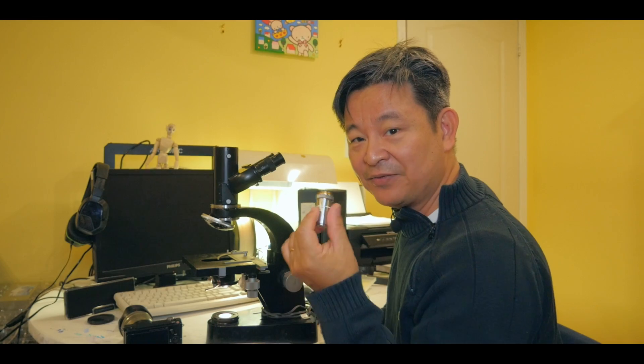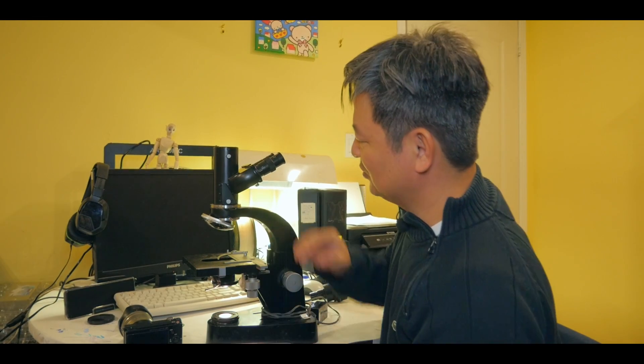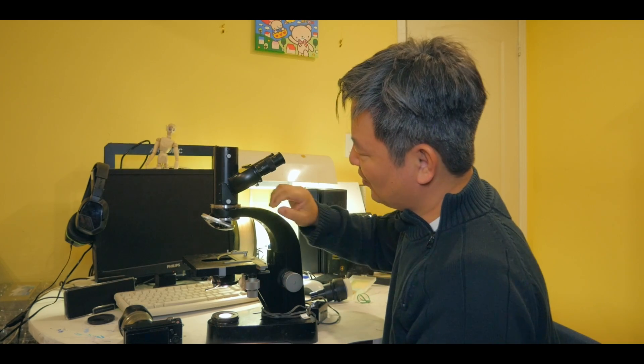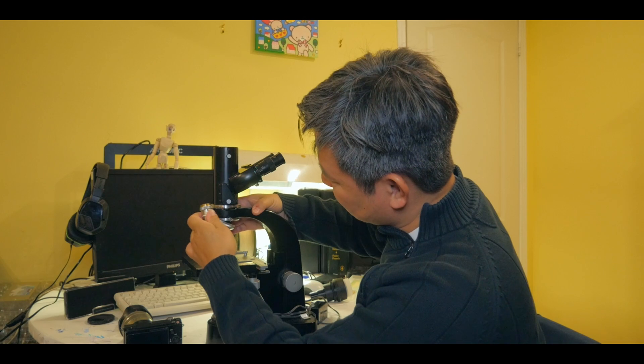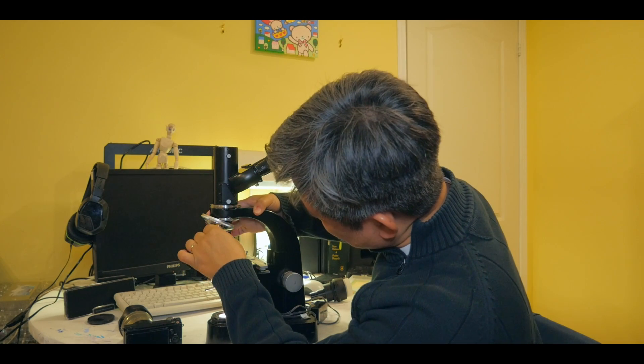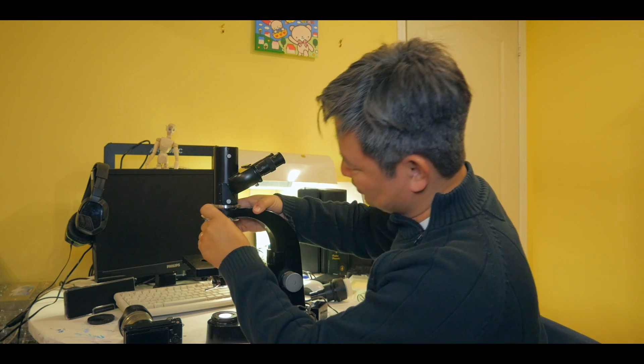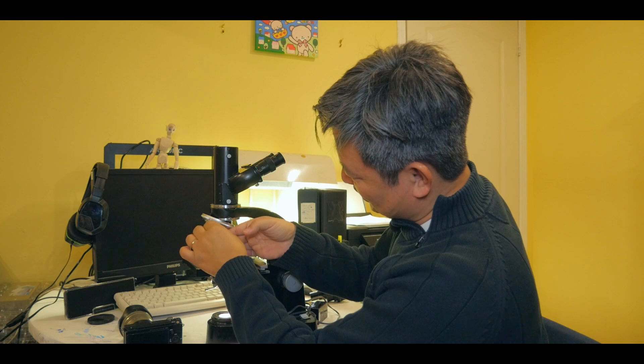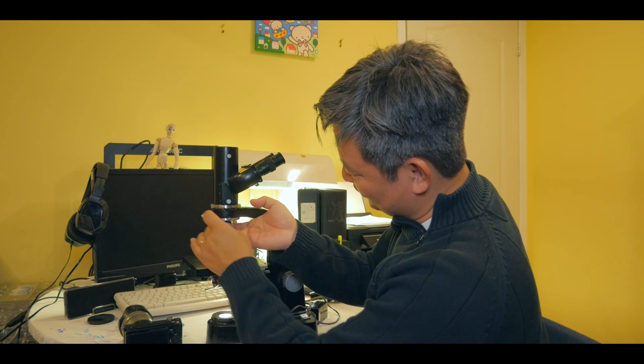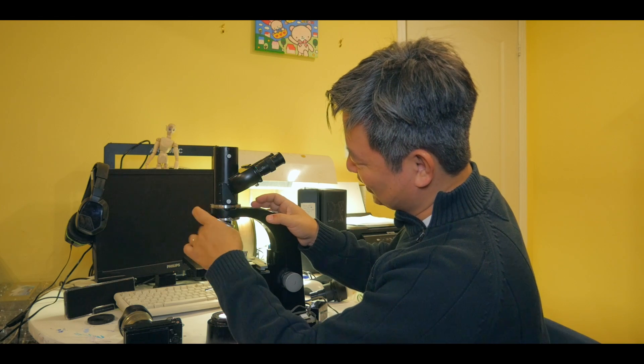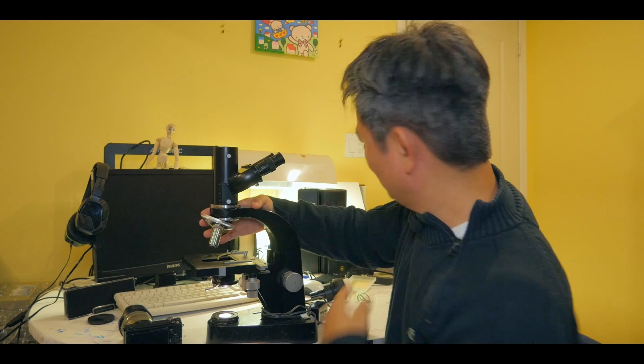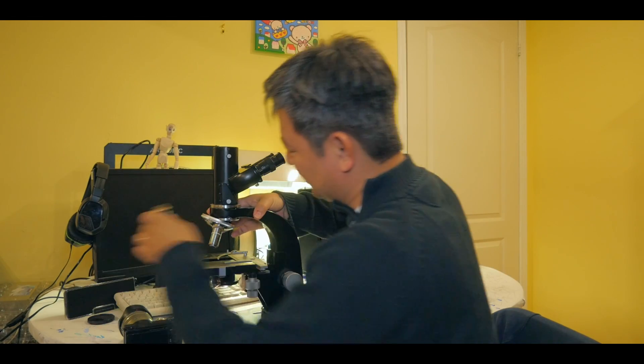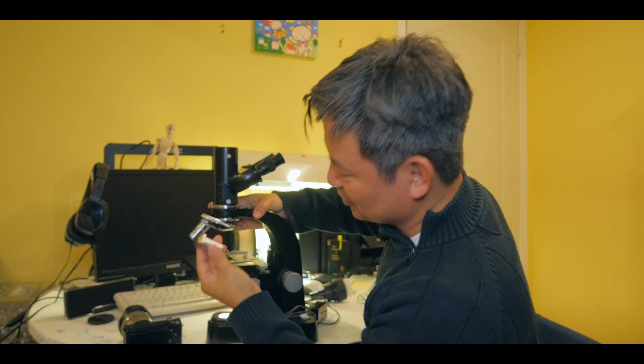Now the objective lens from the Amscope microscope can now be replaced into this Leica microscope, right? This classic microscope. It works really well. I'm going to show you the image in a minute, but let me place it in there. So let's go with the 100x objective lens. Let's put that in. See, this is what I like about it. Like, it fits really well. Like, you just screw it in and it works perfectly. You see that? There we go. Standard, right? That's what I like about it. Even a 1970s microscope still works with the objective lens of the 1990 or 2000s, right? So it works really well.